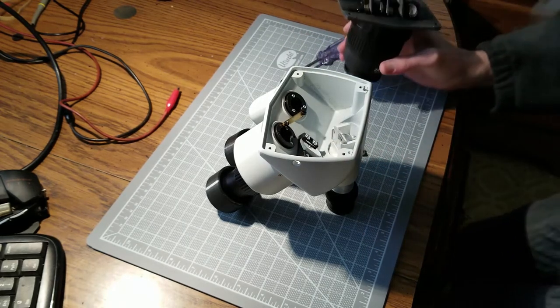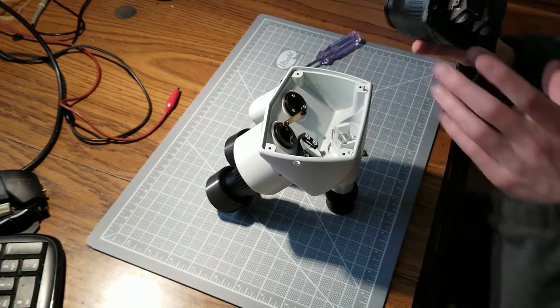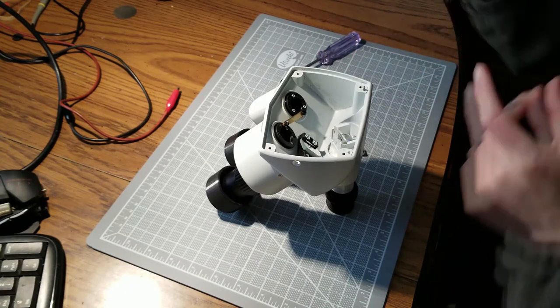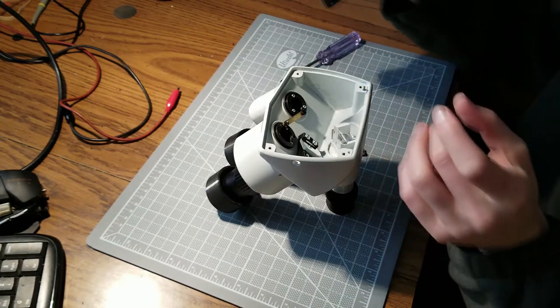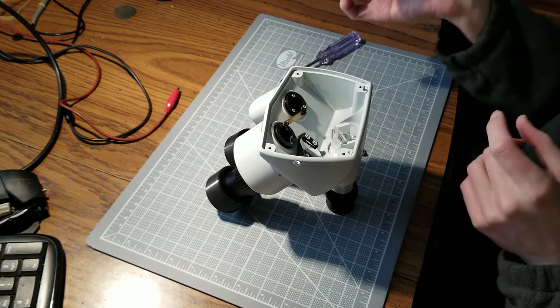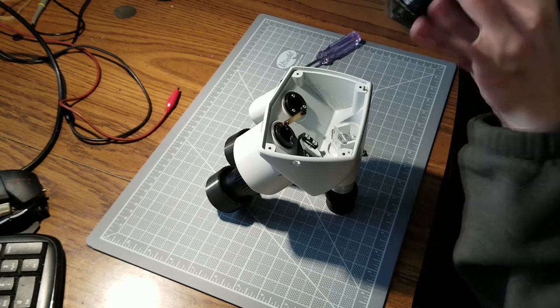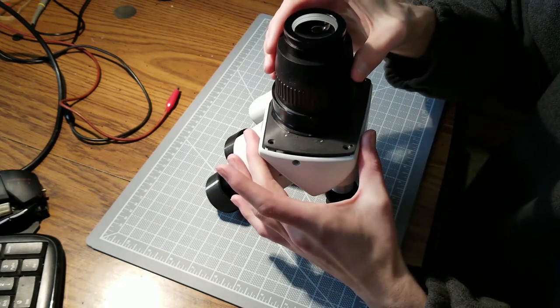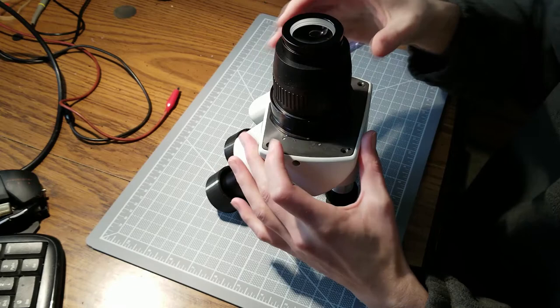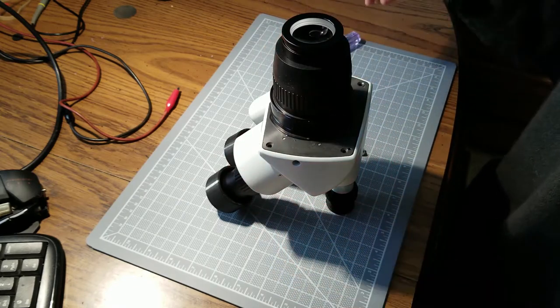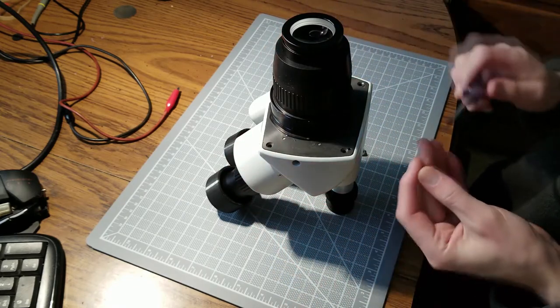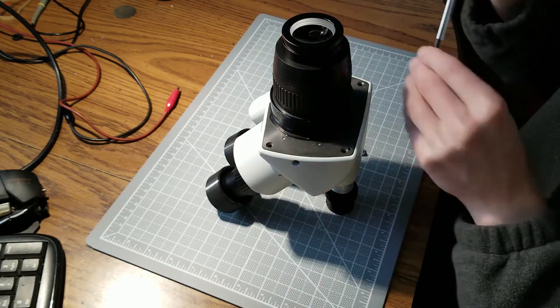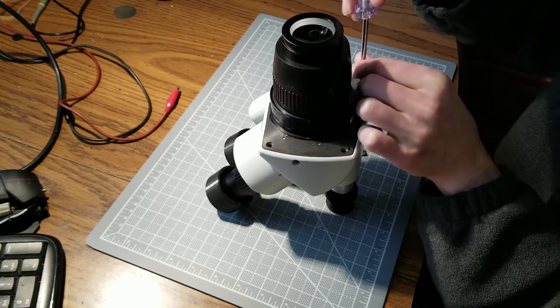And as you can see, this whole thing is not hermetically sealed. It's made in a way that dust isn't going to easily get into it, but there's not going to be any air movement really through it, so it's pretty safe from the incursion of dust, but not absolutely.